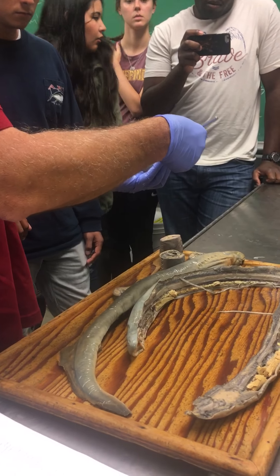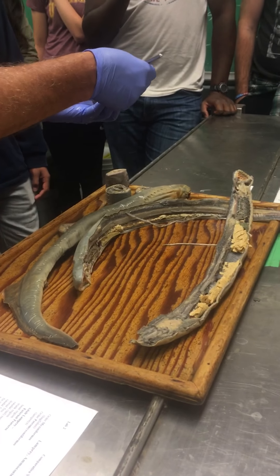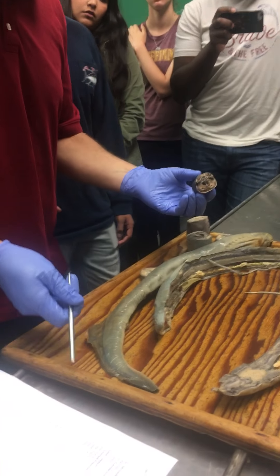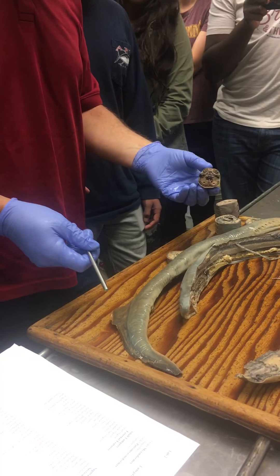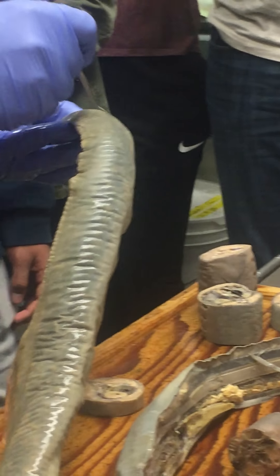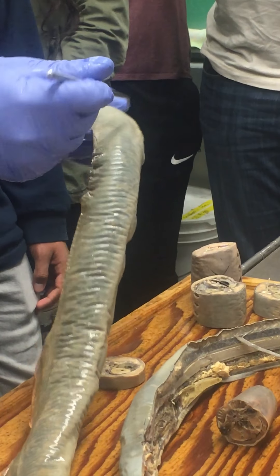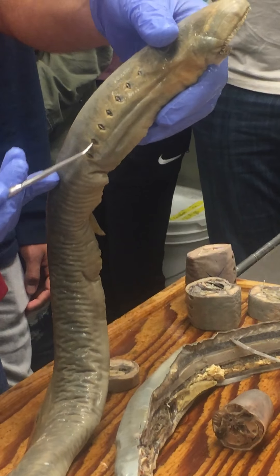Particularly in these fixed specimens, the skin over the eye gets kind of opaque. Those are just the lateral eyes. External gill slits would be here — these are the external gill slits like that.